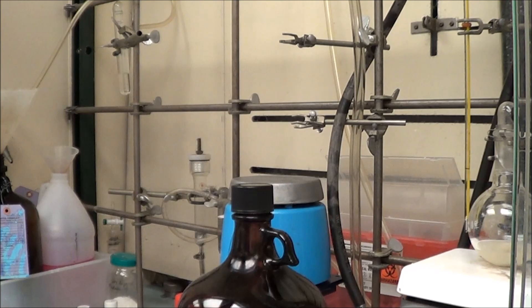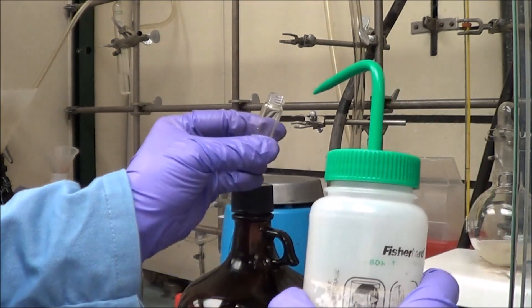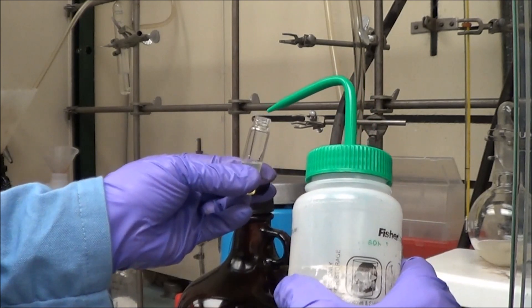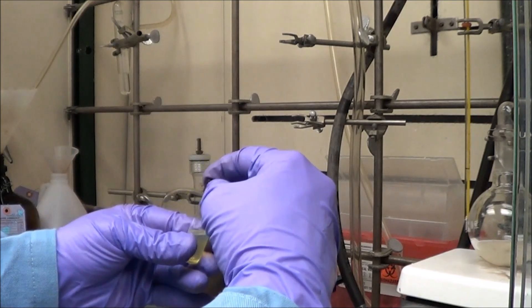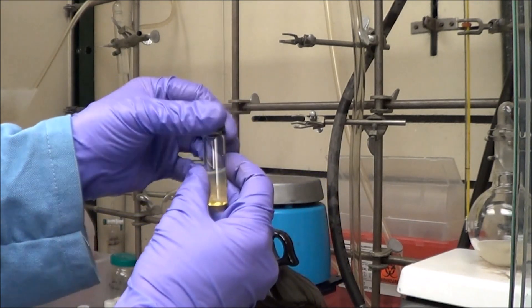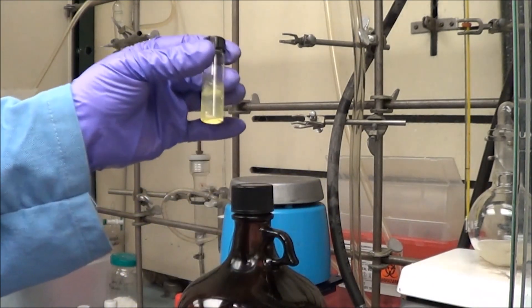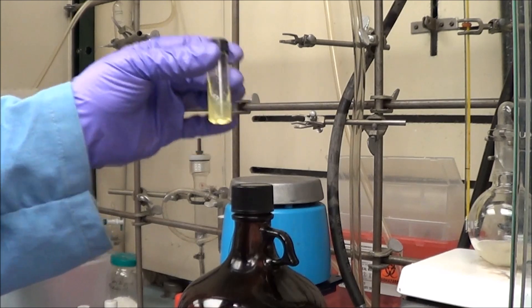Add a little bit, just two drops of methanol, and the polymer will go right in. Sometimes I have to sonicate it and sometimes stir it a little bit. But if you find you have to do that to excess, something's wrong, and you're probably not going to get a good phase transfer yield.